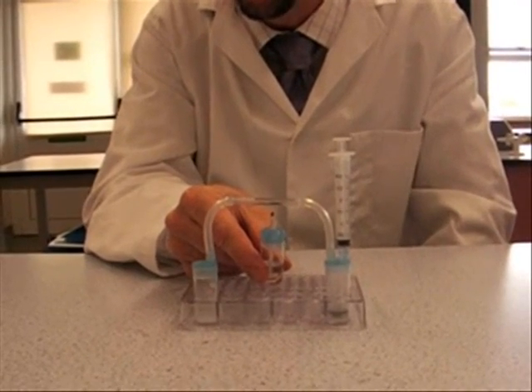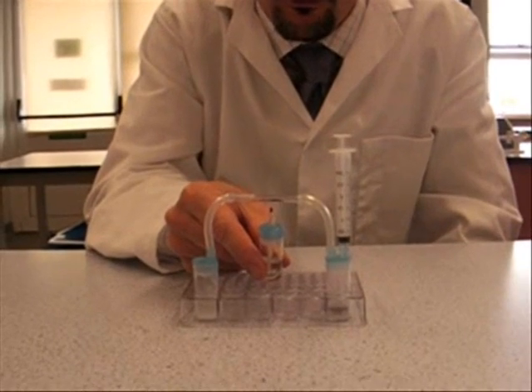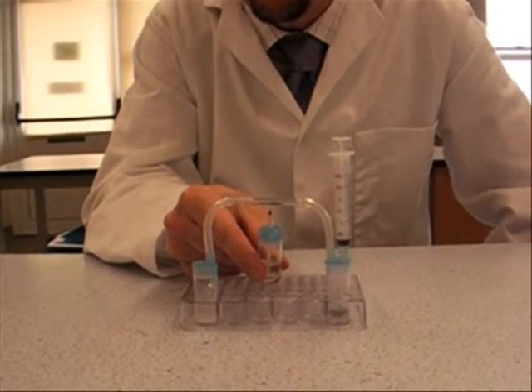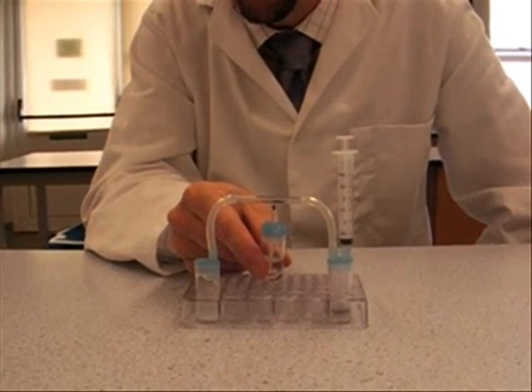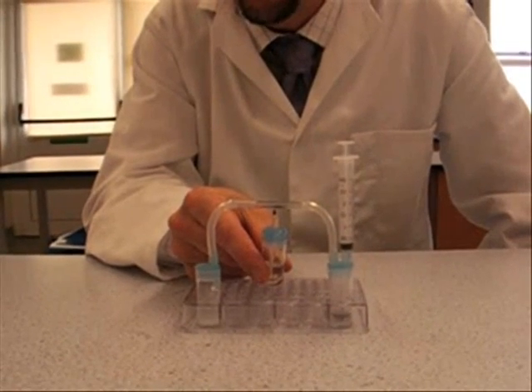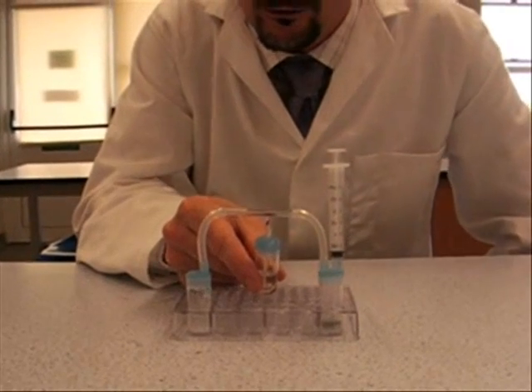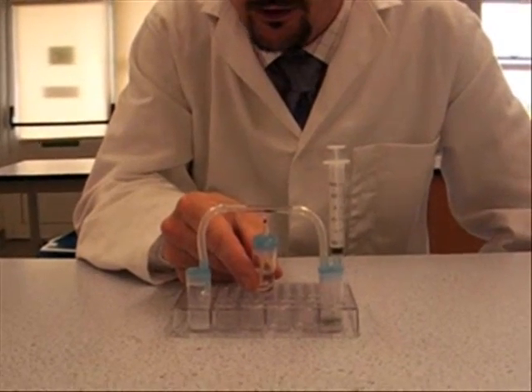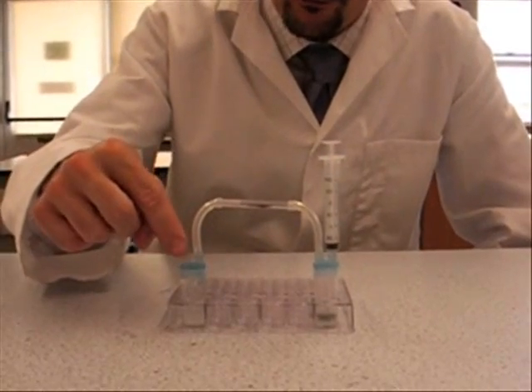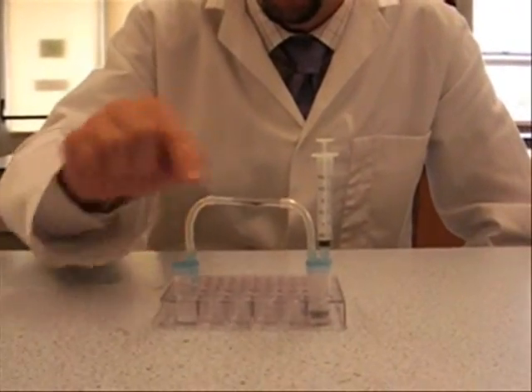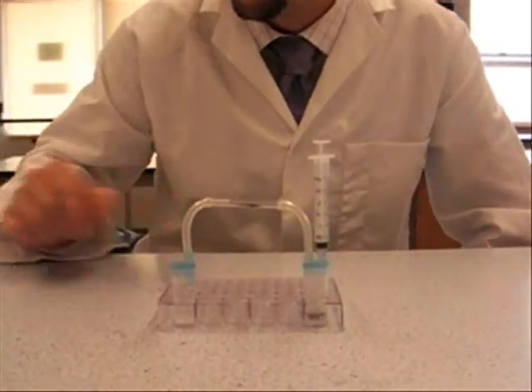Make sure that when you remove the heat after a couple of minutes, keep an eye on it to make sure that no water is being sucked up backwards into the tube. If you think that looks like that's starting to happen, then you need to remove this tube on this side to stop any water being sucked backwards into it. And that is it.